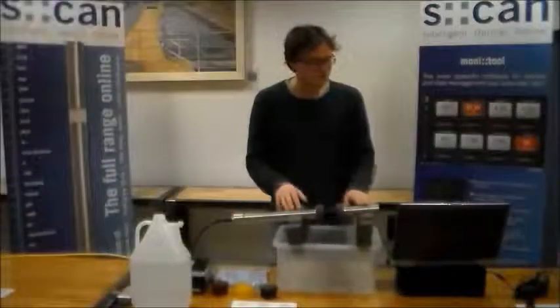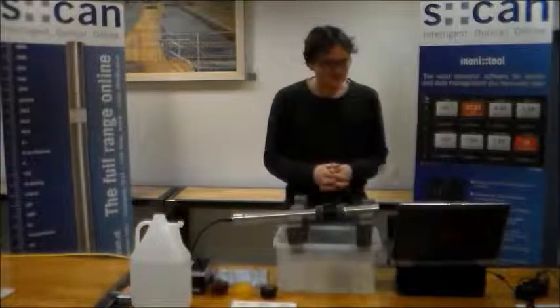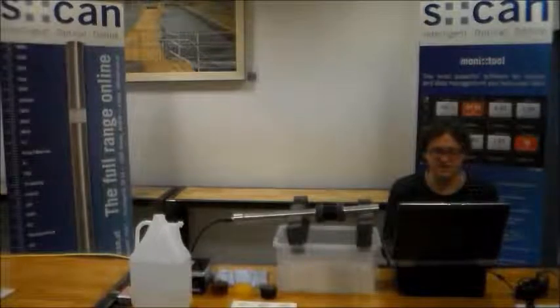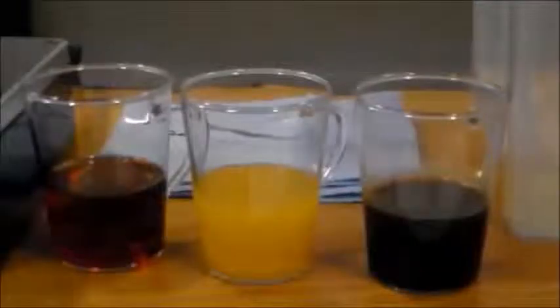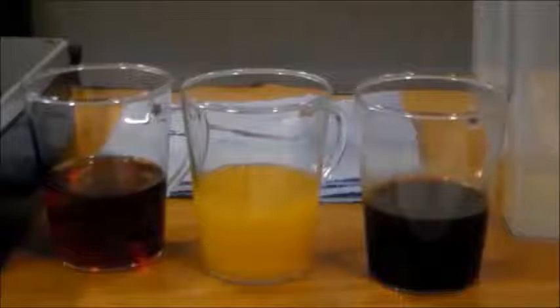So what we are going to test now is to train the alarm algorithms to react on one of the juices and not on the other one. So we are going to classify one of the juice events, for example the orange, as a false alarm, and then retrain the alarm algorithms.